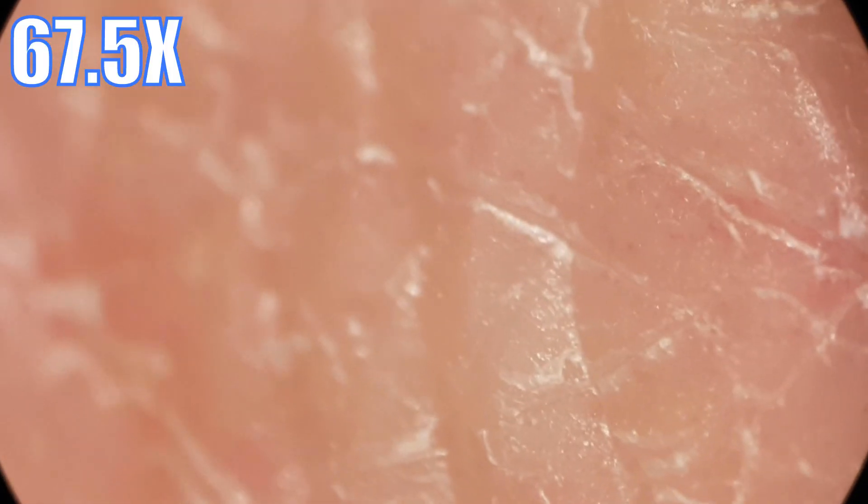It's a pretty rough terrain. I purposefully didn't moisturize my hands just for you. You can see that my skin is pretty flaky — my right hand is just really dry. It's always only my right hand that's dry, not my left hand. I don't know why, but it's a problem I face every winter. The problem with filming your own hand is that the thing you're looking at isn't sitting still at all.